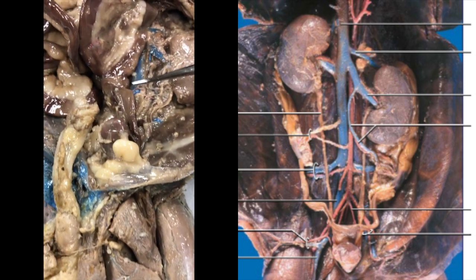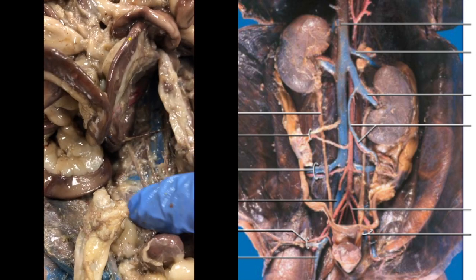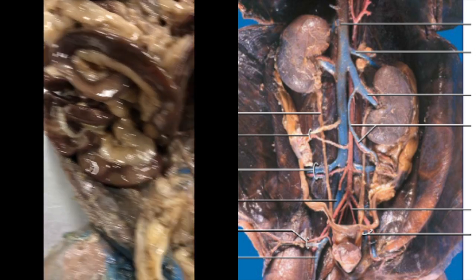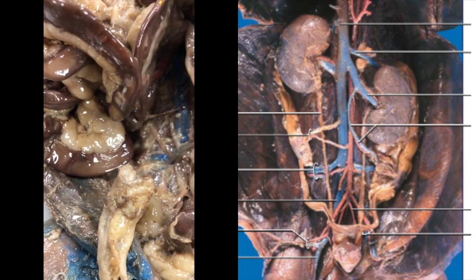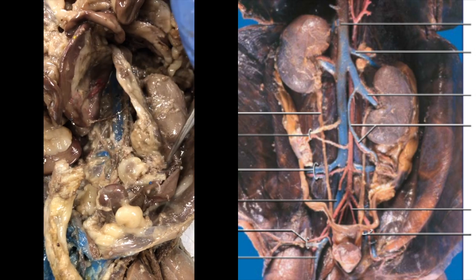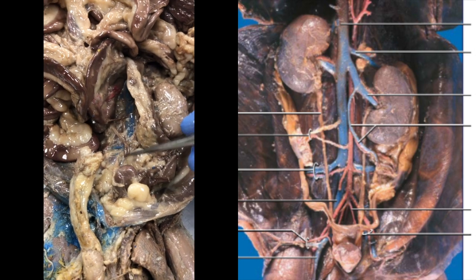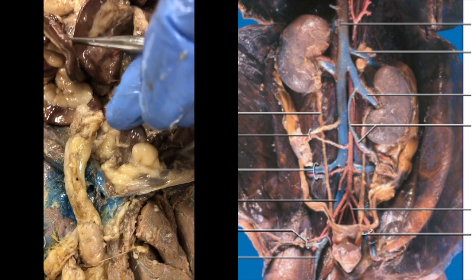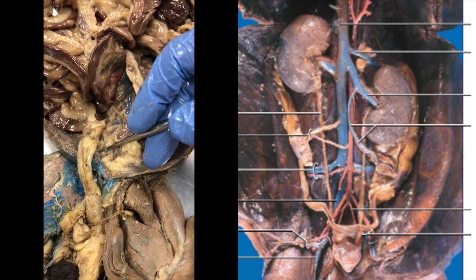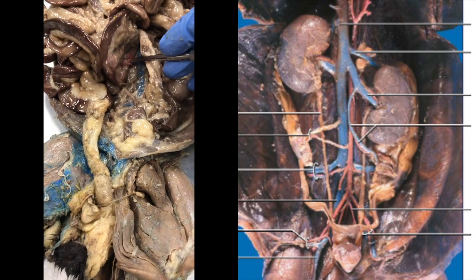But anyway, the inferior vena cava continues to descend. Right here's the bladder. But the truth is, I think that right there might be the right iliolumbar vein. It's another one of the matched veins, but you'd really need to spend some more time liberating this. It should be bilateral on both sides. You can see there's the left iliolumbar, there's the right iliolumbar. They're definitely below the kidney level. And if you follow this down, here's his bladder, there's the penis, but most of the other structures, like your internal and external iliac arteries and veins, are going to be buried in this pelvis area. So unfortunately, I can't do a great job of showing you that.